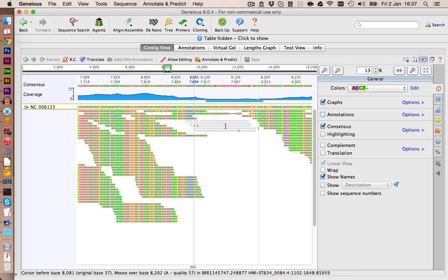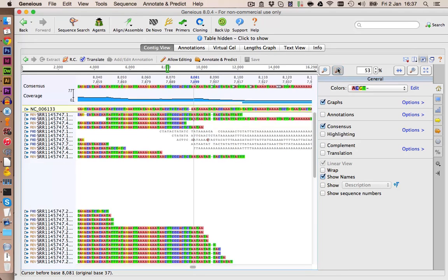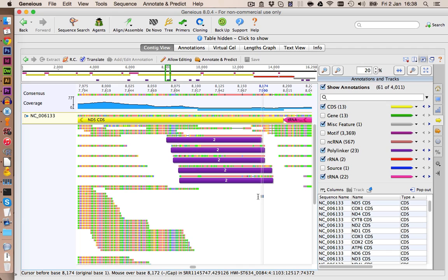I just realized that the annotation I used to mark those hits doesn't let them highlight. So let's zoom in here and see if they are looking good. Doesn't look exactly right. Actually, let me do this again and add an annotation which allows highlighting. Give me a second. Okay, here we are again. And we can see that this annotation here marks the new hits.